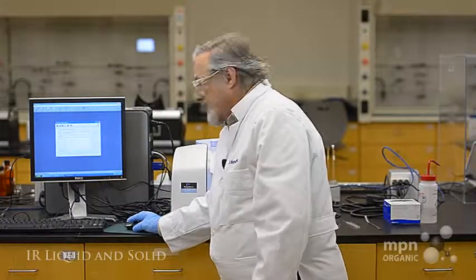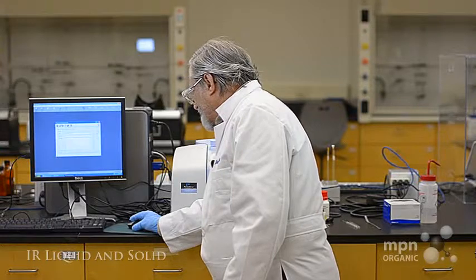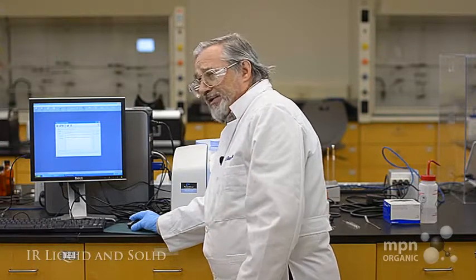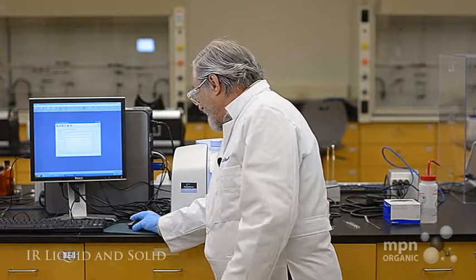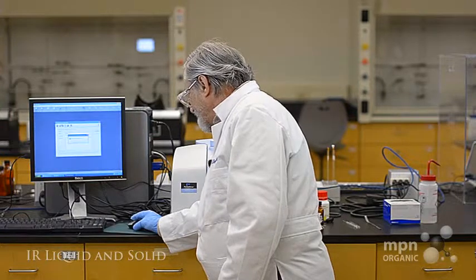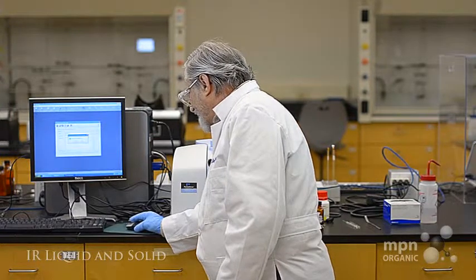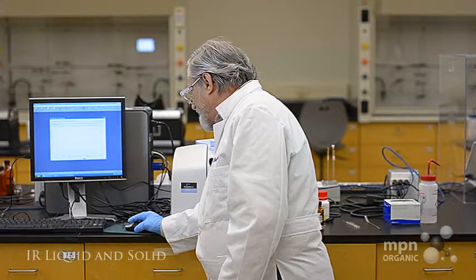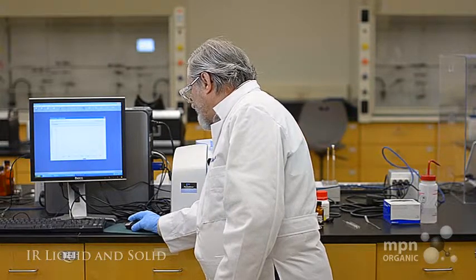So now we're at the point where we can hit Start. We're not going to hit Background again because we've already taken a background. We're going to hit Start. It says Warning Duplicate File Name. Don't worry about that. Just hit OK and Scan.